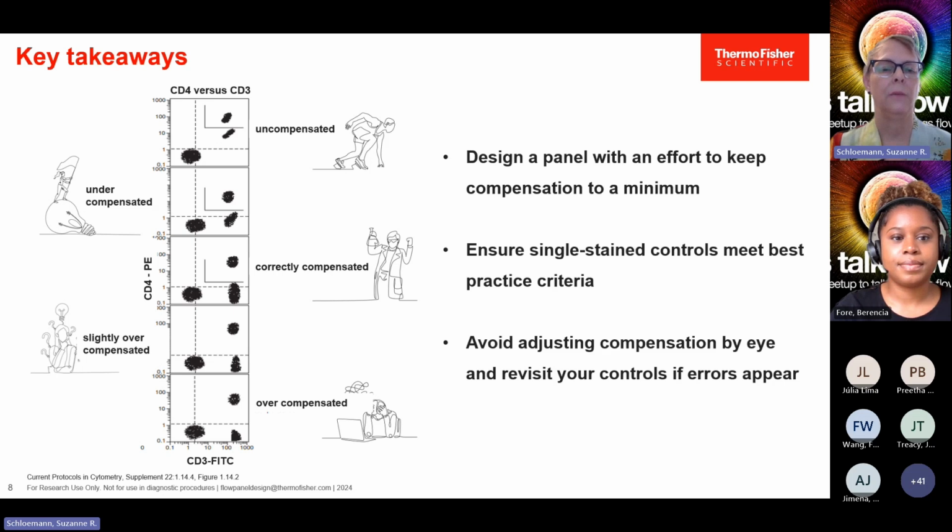So just in summary, we have all of these different situations that might occur when looking at your data set. So this is a plot. We have CD3 versus CD4, and this is uncompensated data. So we can see this population is in the double positive quadrant when it should be in the single positive quadrant. We apply some compensation, but not quite enough. You can see that still a portion of your population is in the double positive quadrant. In the third plot, we see correctly compensated data. The fluorescence intensity of your stained cells is normalized to the signal intensity of the negative population.